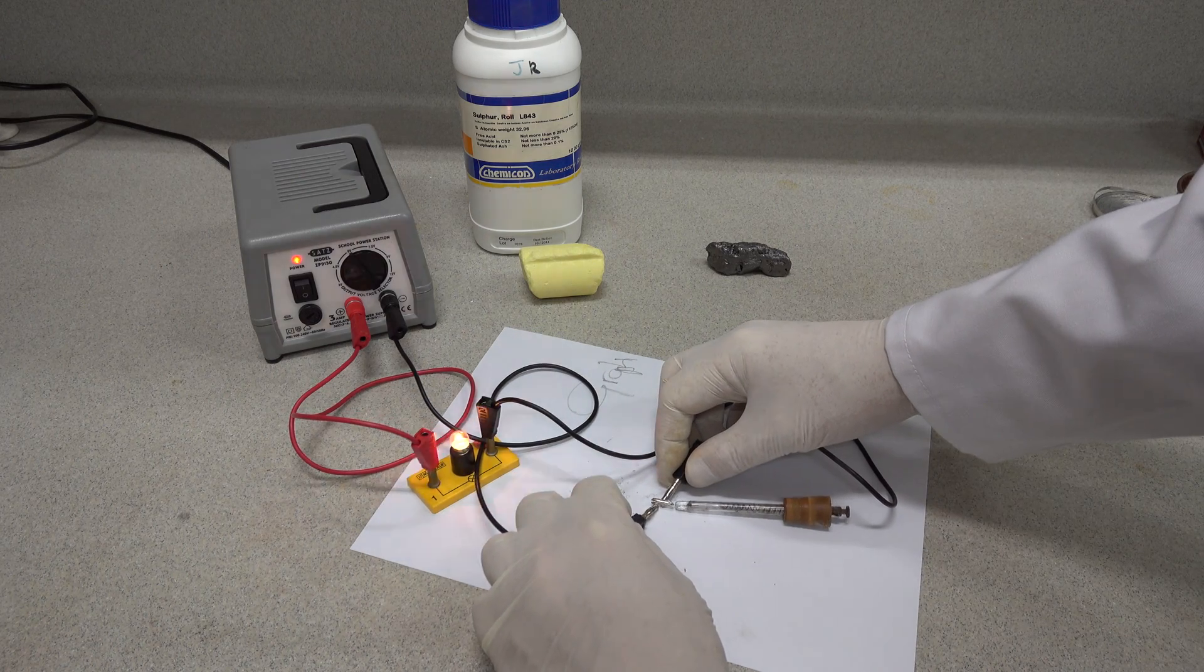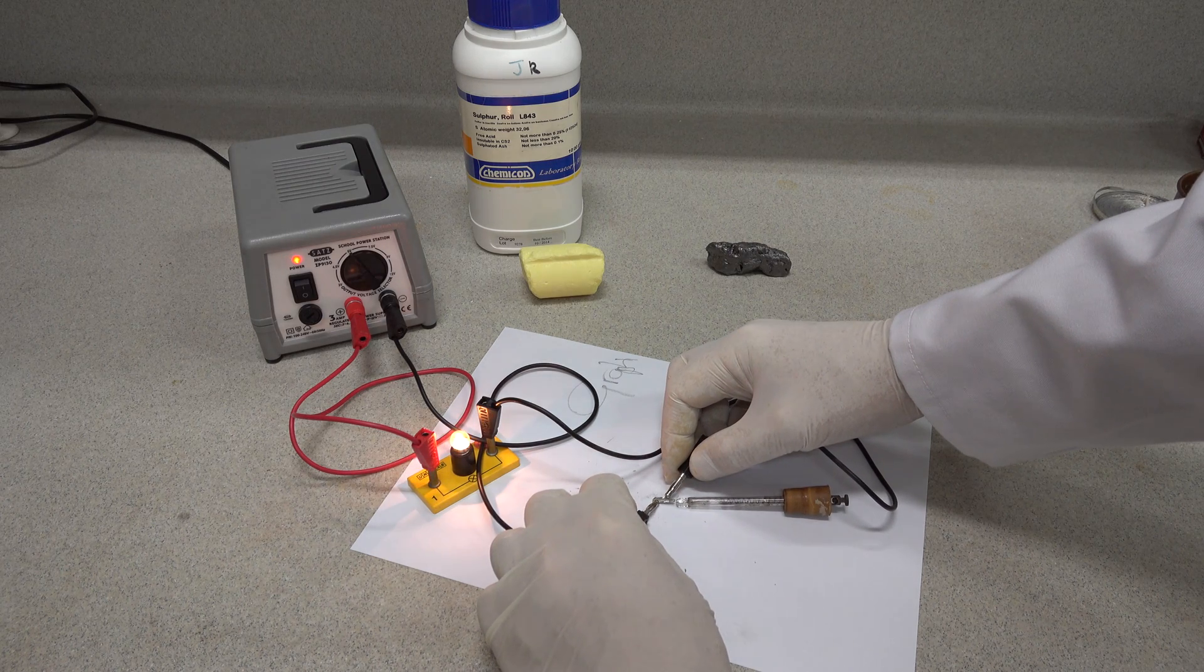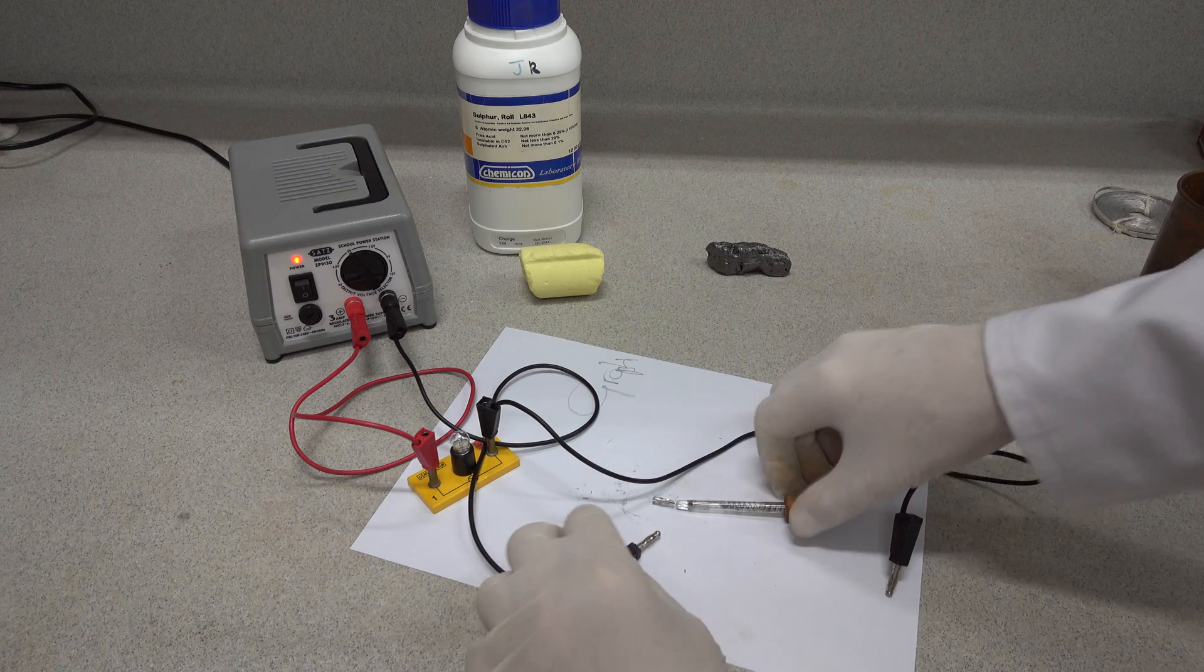Well, you can see, touching either side of the electrode or close by, yes, indeed it does. Platinum conducts electricity rather well.